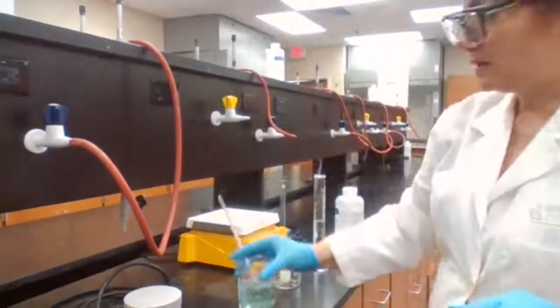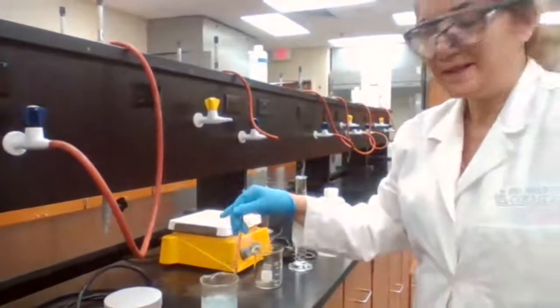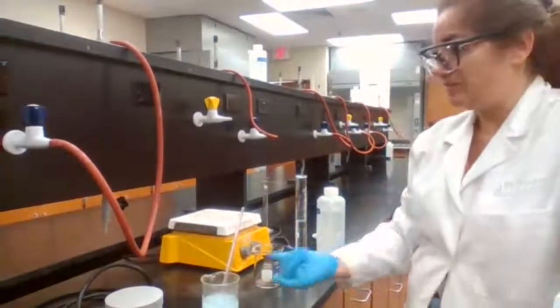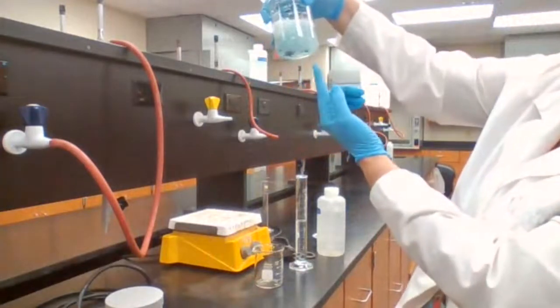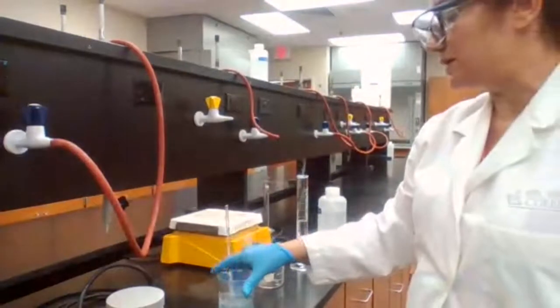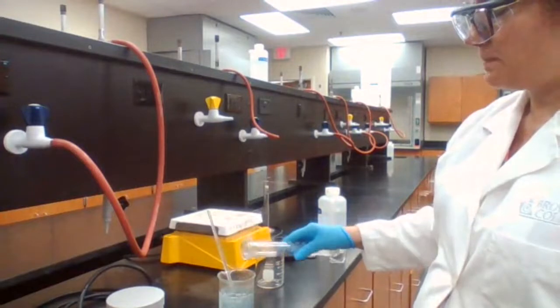The extra sulfuric acid, the 3 milliliter that was used in the procedure, that extra sulfuric acid is to remove any leftover of magnesium. I just look at this and there is no really leftover of magnesium, so I don't have to add the extra sulfuric acid to this mixture.